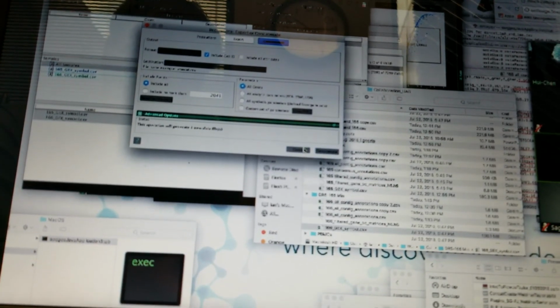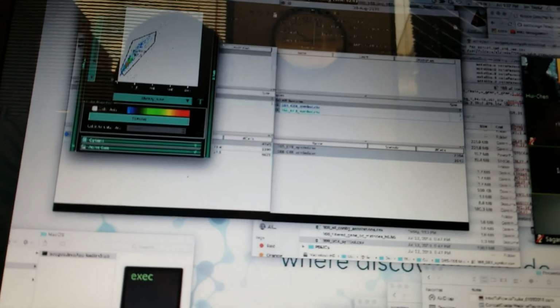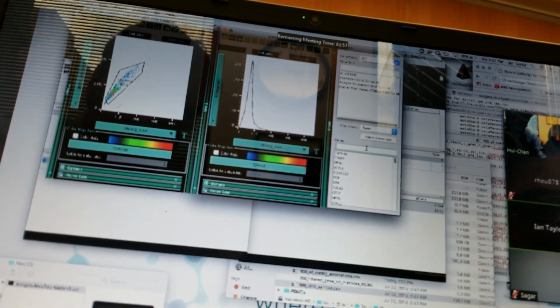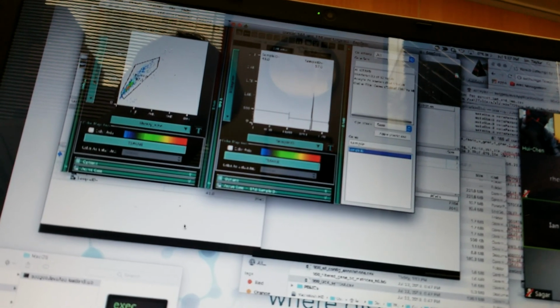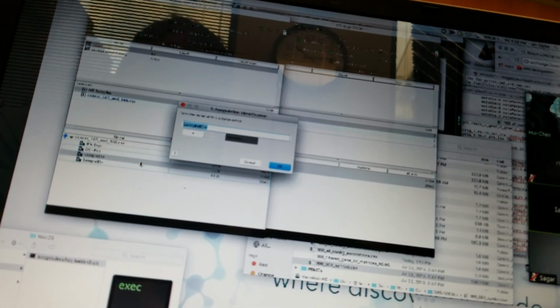So this is just to give you an idea of how to export. Now if I go back to this combined file, I can actually just reopen our graph window here. I'll duplicate that again. And if you look at a histogram of sample ID, this parameter distinguishes between the two samples that we combined. And then from there I can infer which one came from which sample. Oh, okay. What would be important is if one's a normal, or like one compared to the other, but on the same kind of plot.